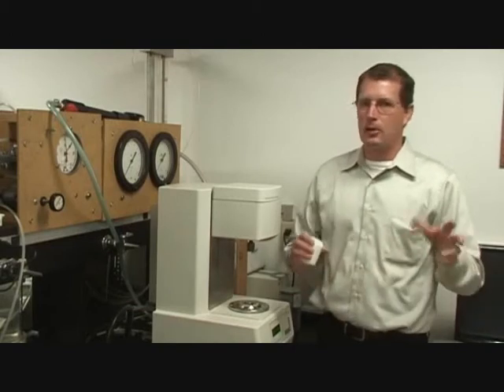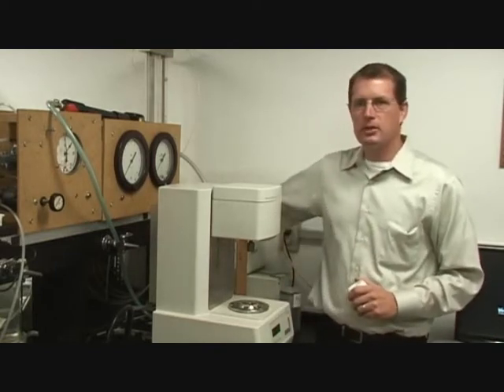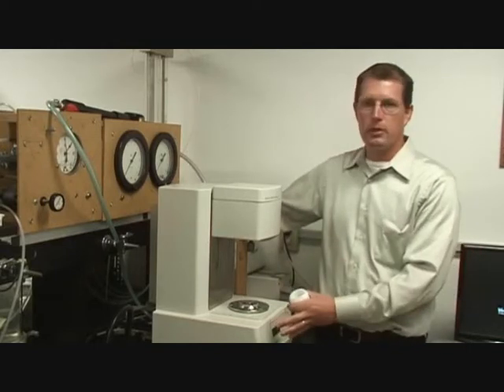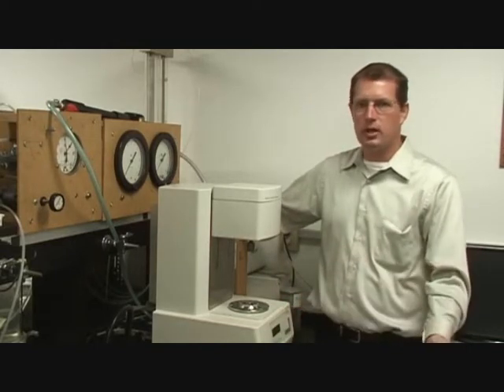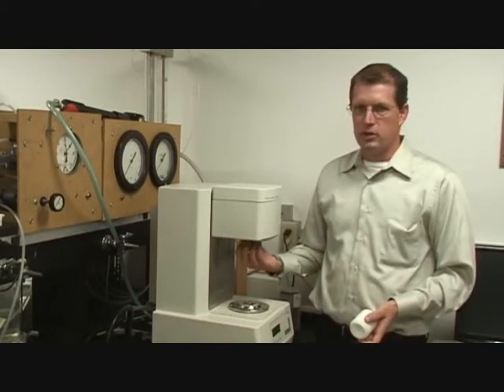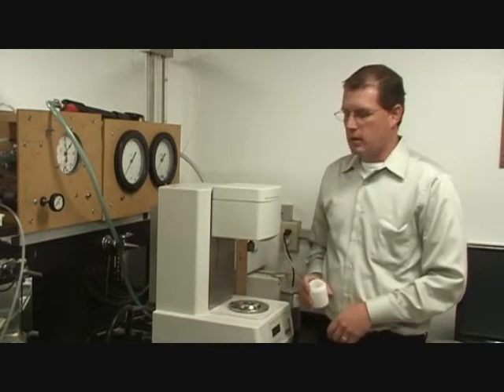First thing I like to do is scare people, tell them that. Second thing I like to do is say, however, once you have it on air, it pretty much takes care of itself. If you lose air in the middle of an experiment, it'll shut down. Just don't touch it. It's fine. When you're not running, which is this situation, we don't have a measuring system in there. Got the hood off to the side. We'll talk about that more later.